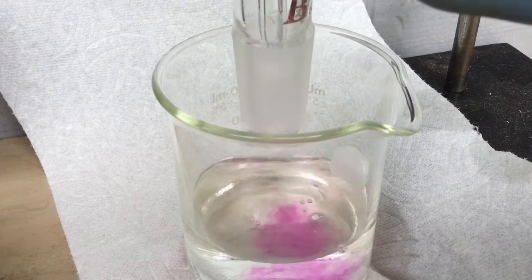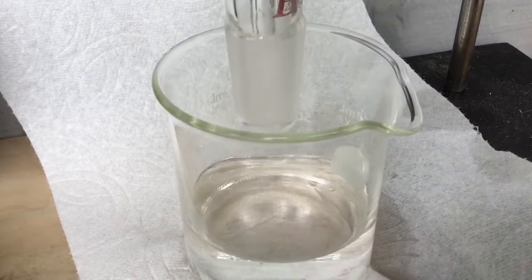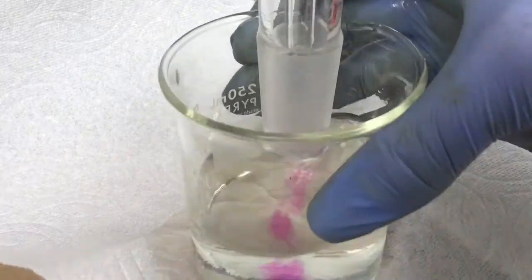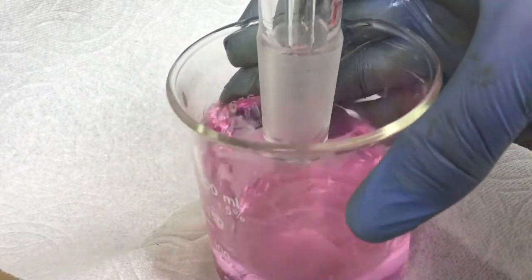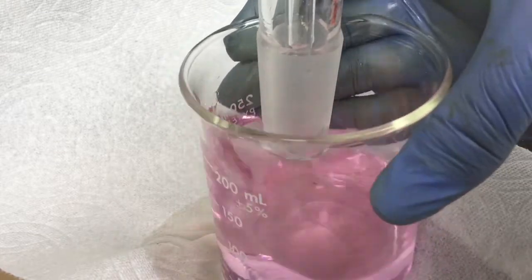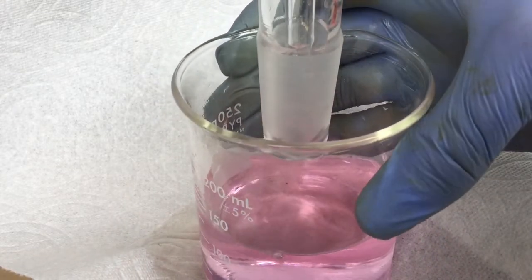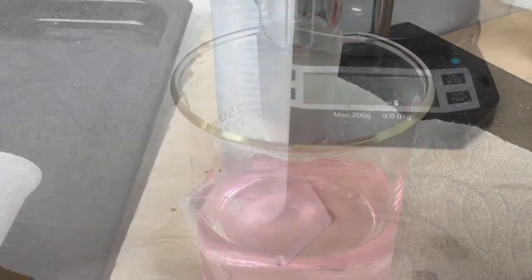Eventually you add one more drop and swirl it, and you've completely neutralized your acid. That's what I believe I've done at this point. Let's see how much sodium hydroxide solution we used.